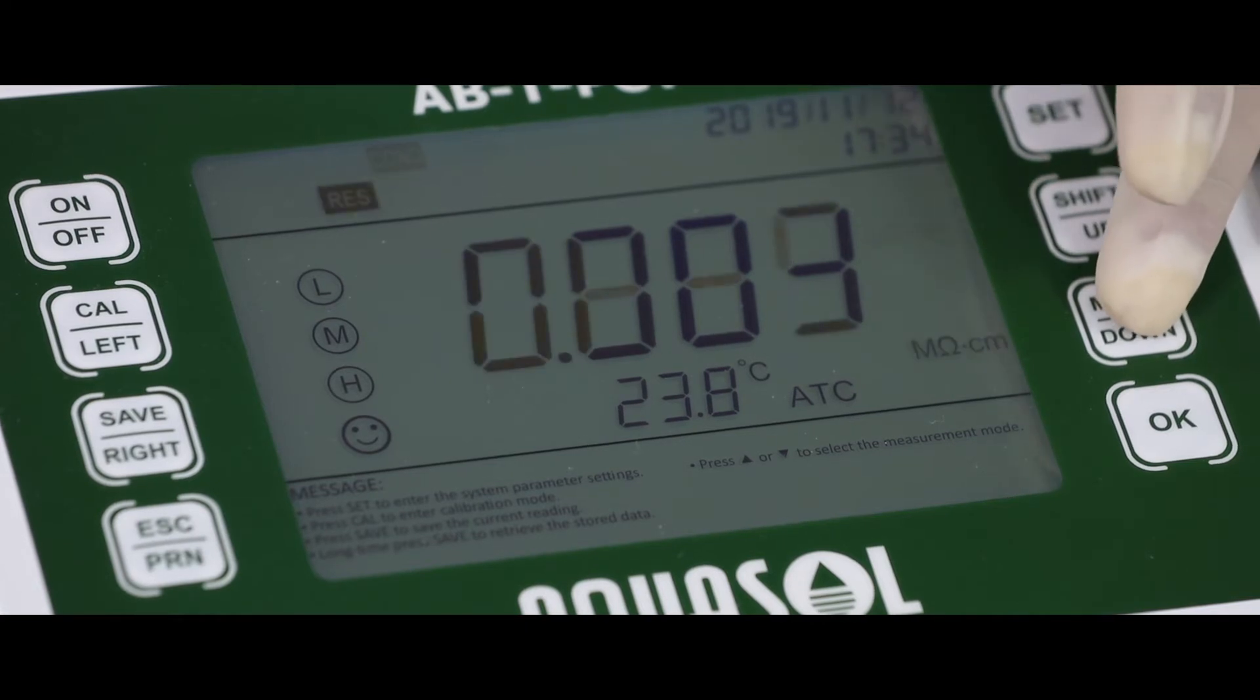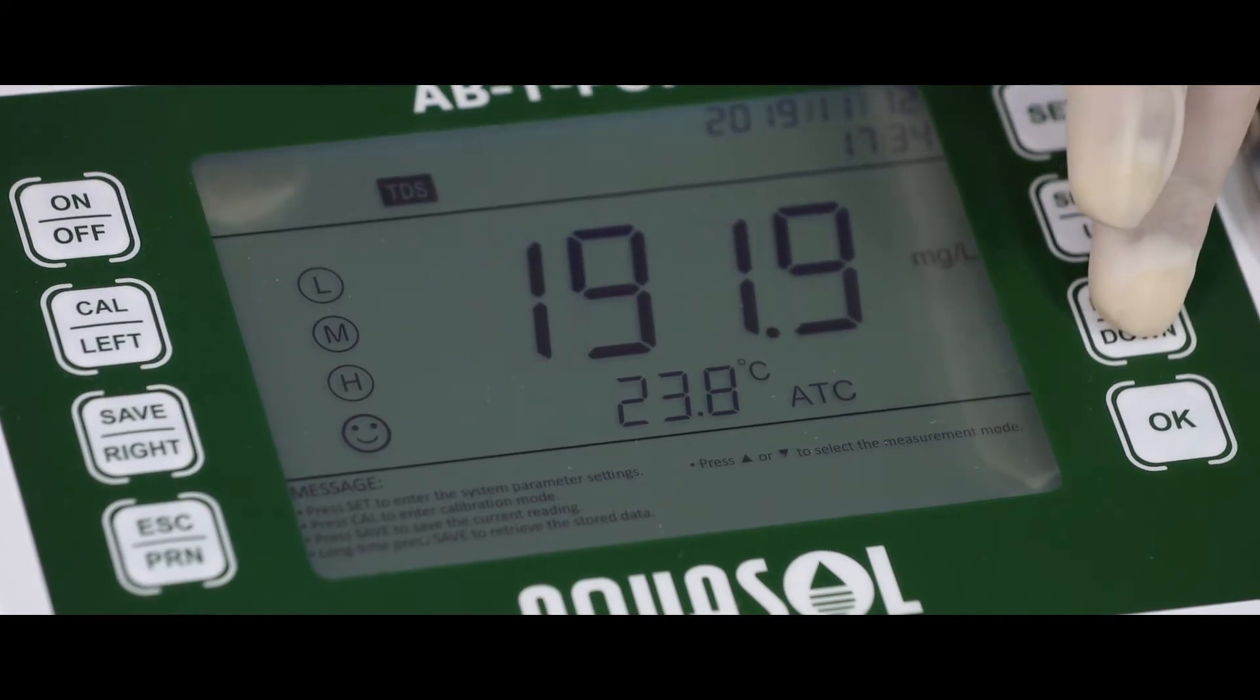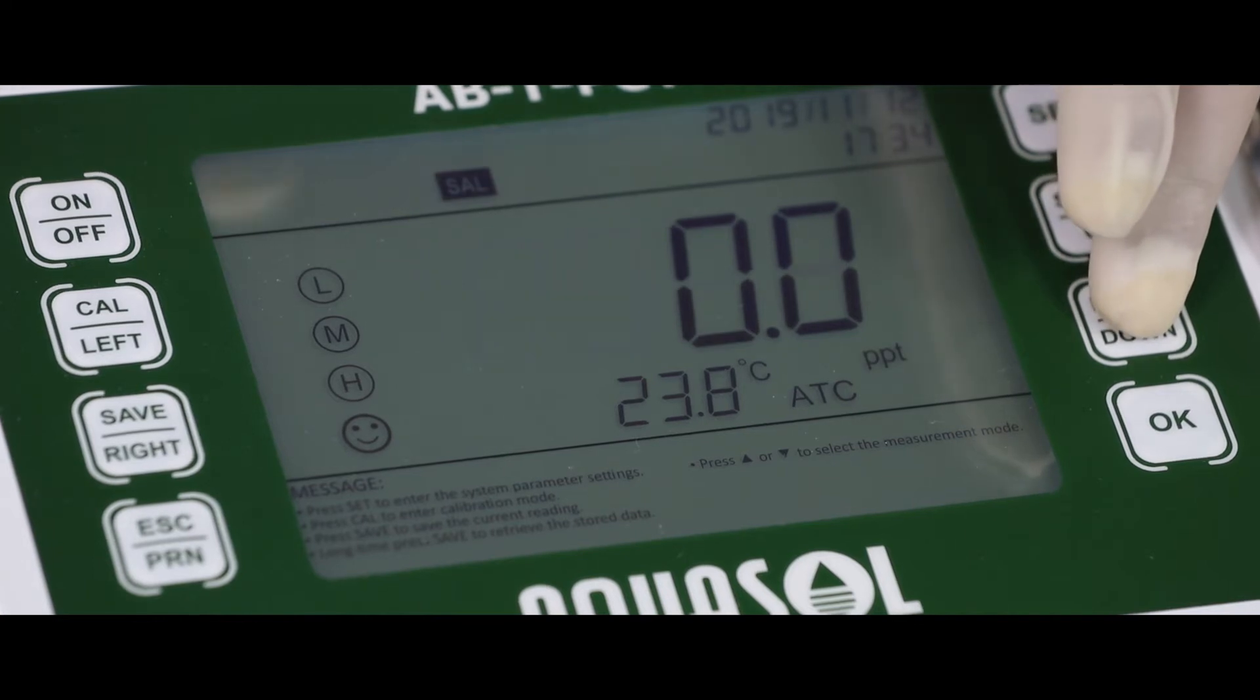Use the mode key to know the pH, conductivity, TDS, salt and temperature of the sample solution.